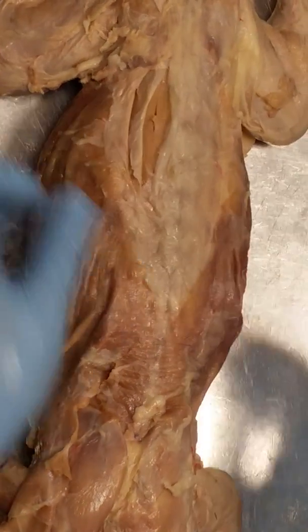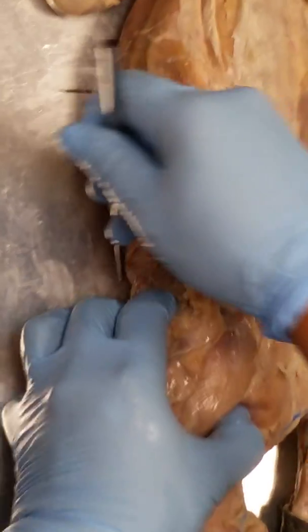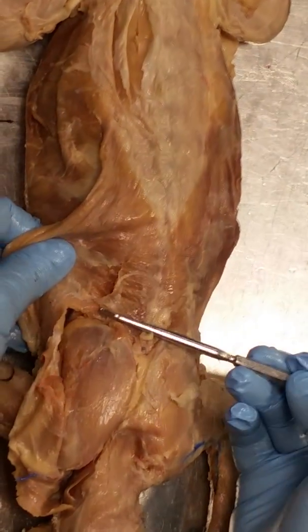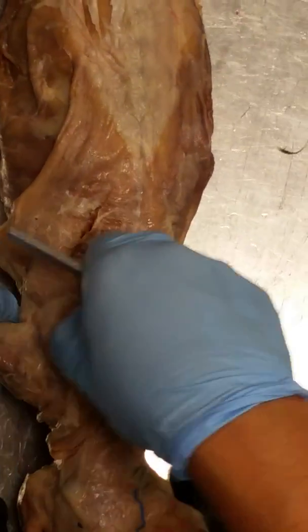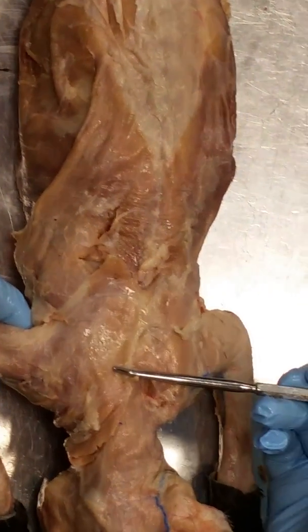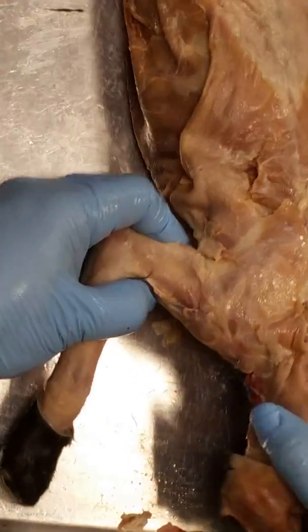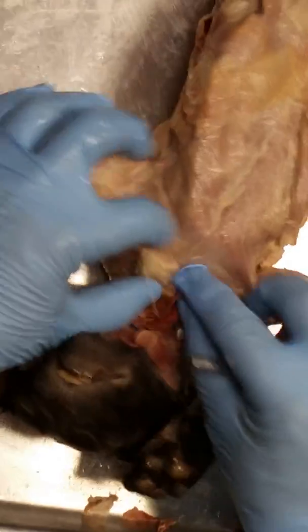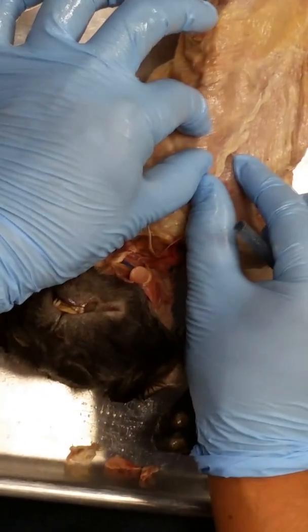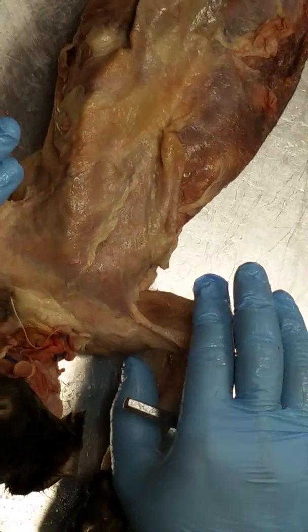Multifidus, longissimus dorsi. Latissimus dorsi. Serratus dorsalis. Serratus ventralis. What is that called? Spinotrapezius. It's okay. It's all right. Spinodeltoid. Acromiotrapezius. Acromiodeltoid. Clavotrapezius. Clavodeltoid. Levator scapulae ventralis. Pectoantebrachialis. Pectoralis major. Pectoralis minor. Xiphihumeralis. Pectoantebrachialis. Okay? We good? Okay.